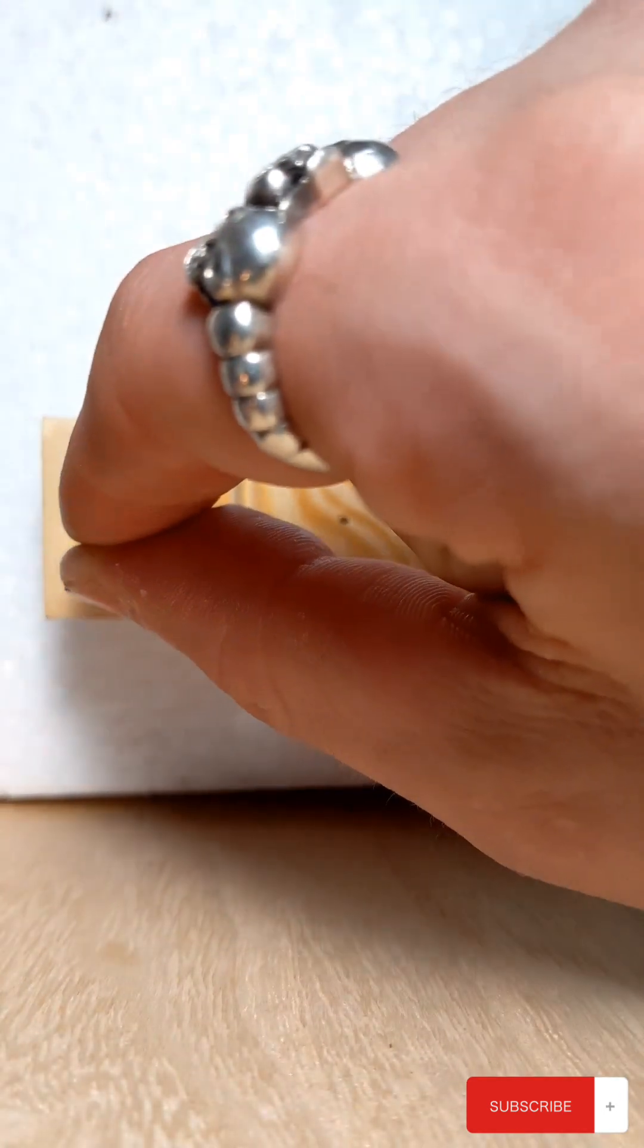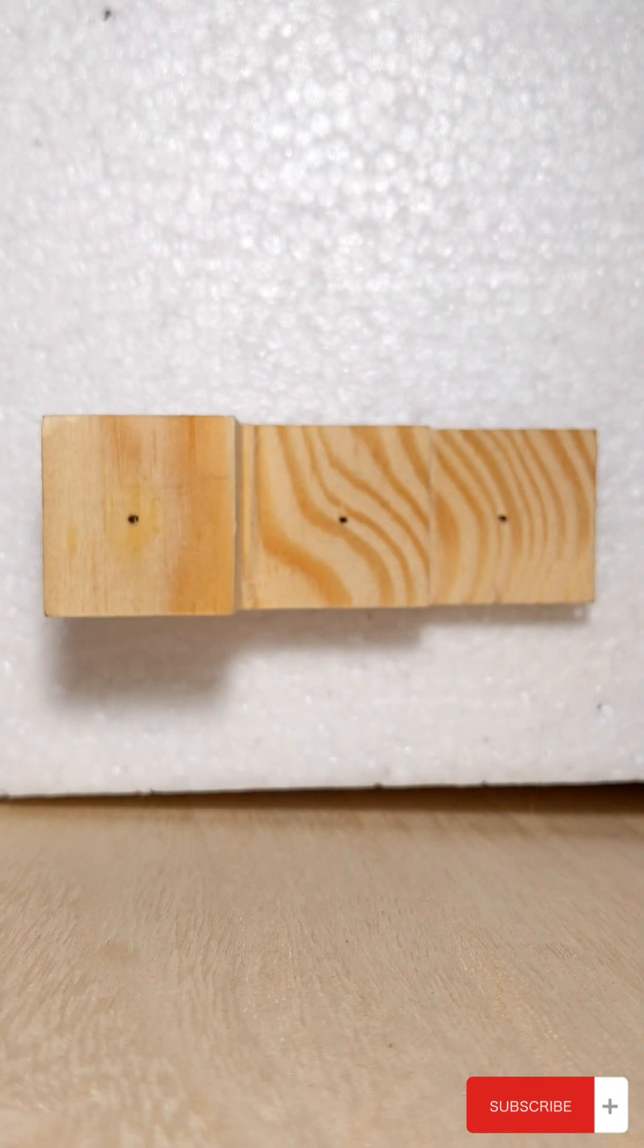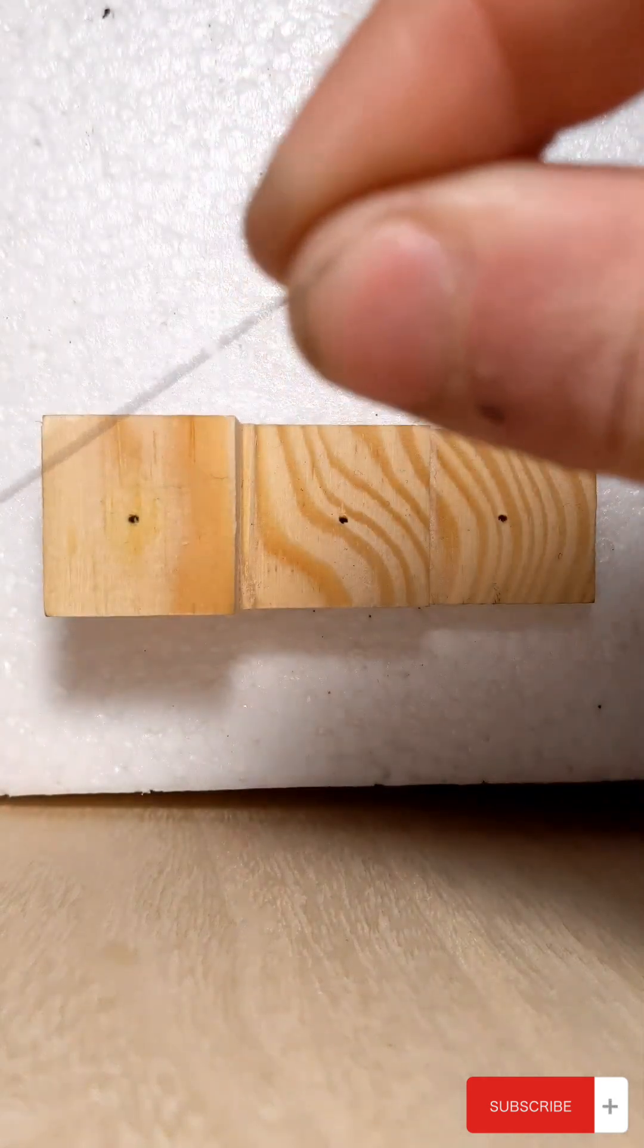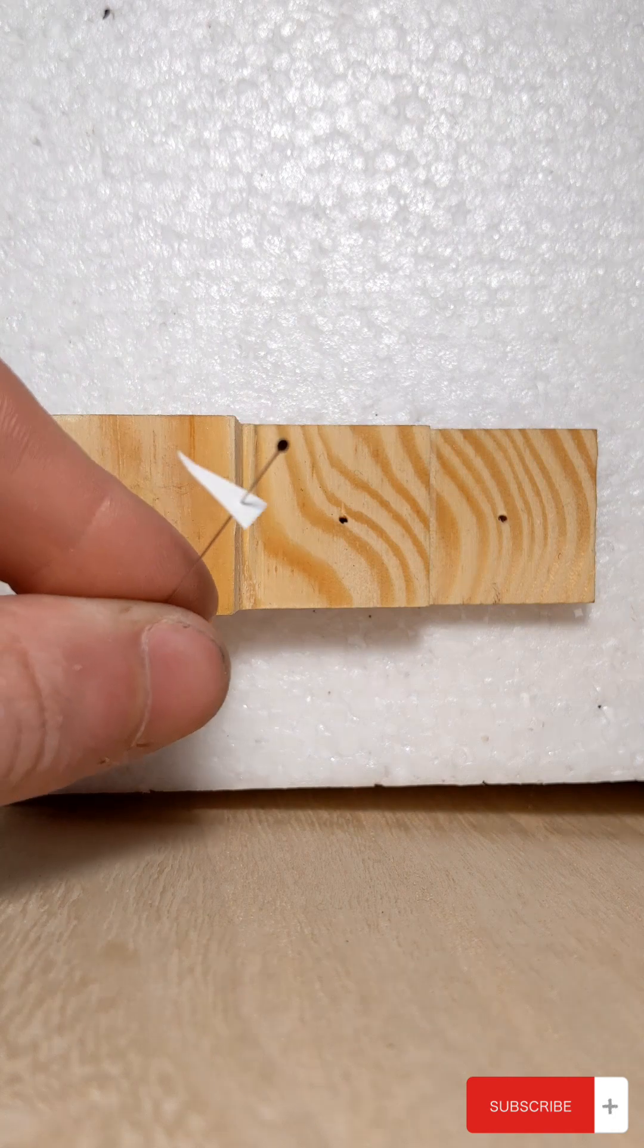Go ahead and push the pin down. Just like so. And now it's holding on to your little piece of paper.